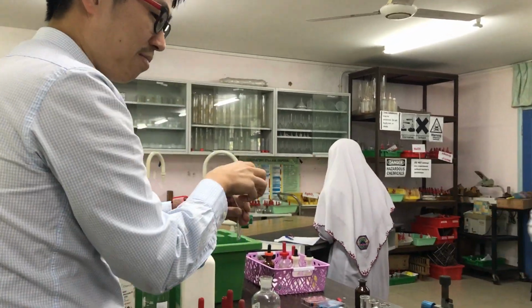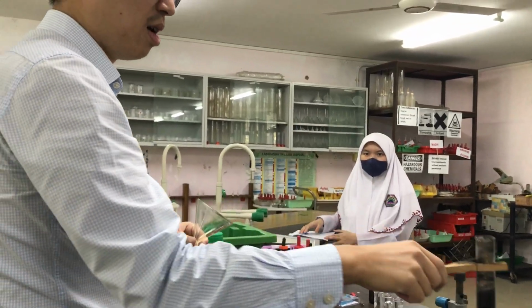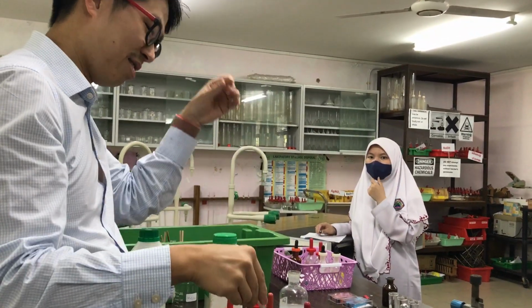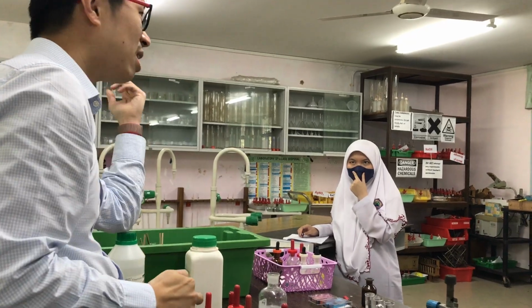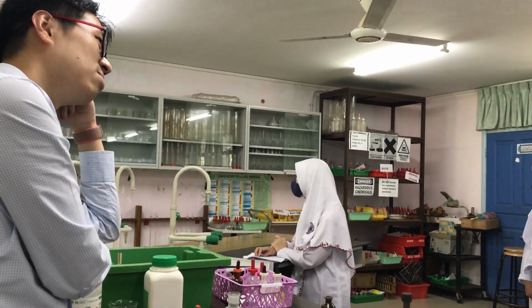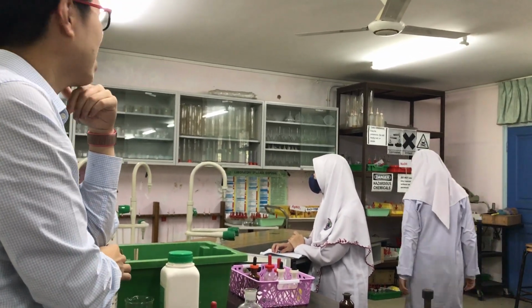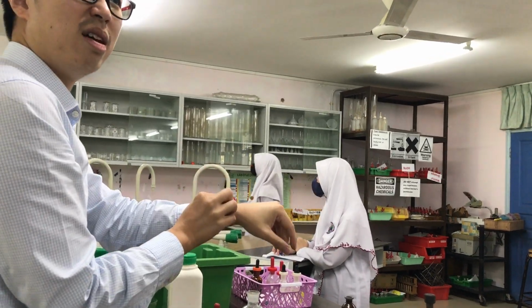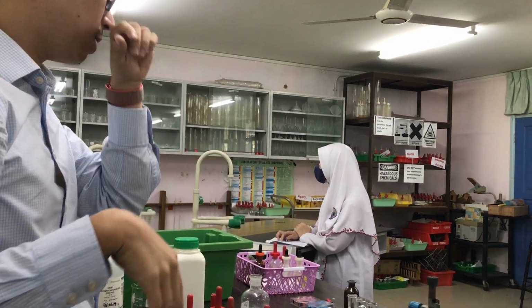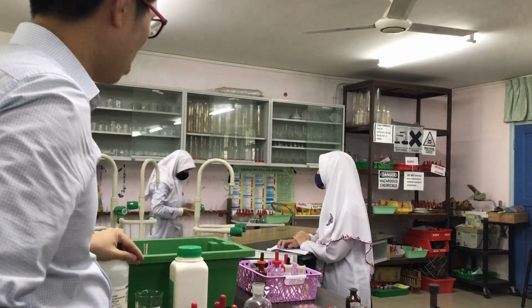Okay. Now, I pause straight away. What do I need? Go and take apparatus from me, someone. What do you want? Who said beaker just now? Go and take that. She said beaker. Is that all the gas ready? Hydrogen, oxygen, carbon dioxide, ammonia, and chlorine left, right?